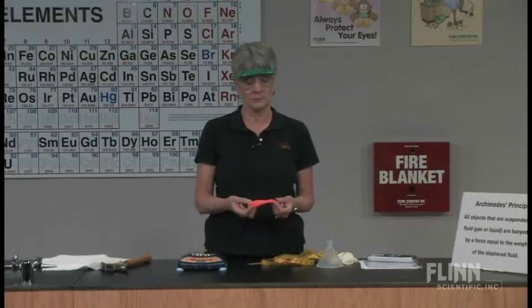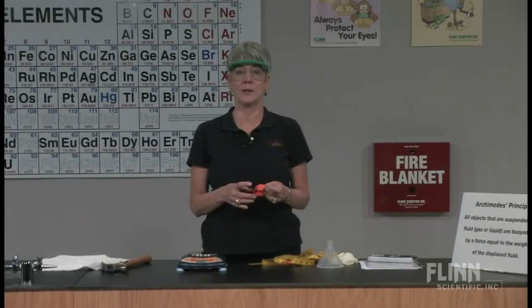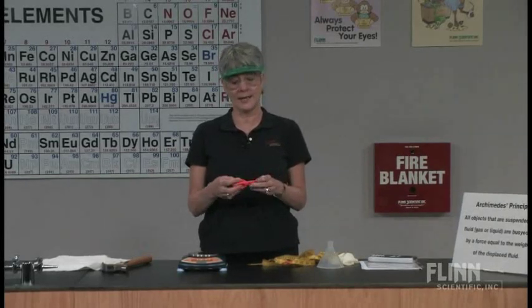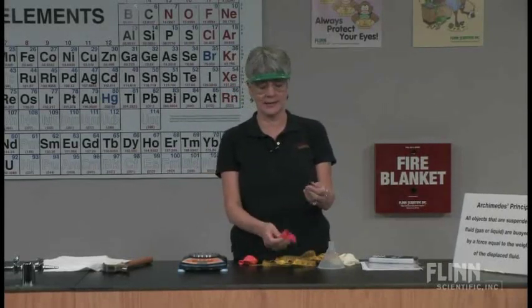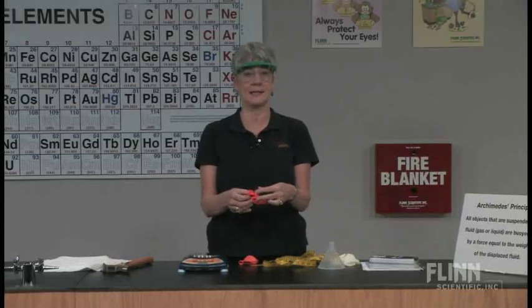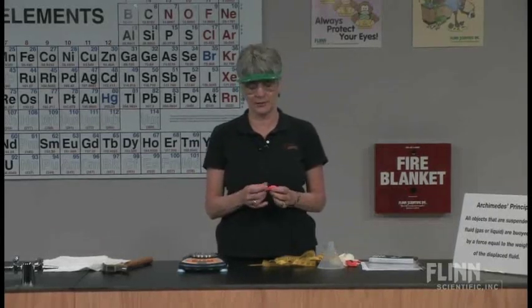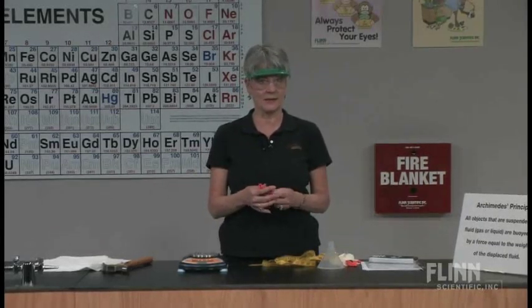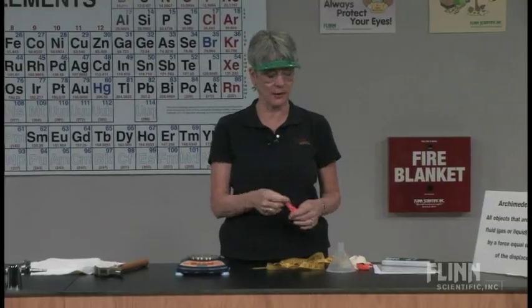We're going to take a balloon and fill it with dry ice, then record the mass loss as the dry ice sublimes and the balloon inflates. I usually put a rubber stopper inside the balloon so that it stays on the balance. I also inflate the balloon several times beforehand to make it easier to expand.